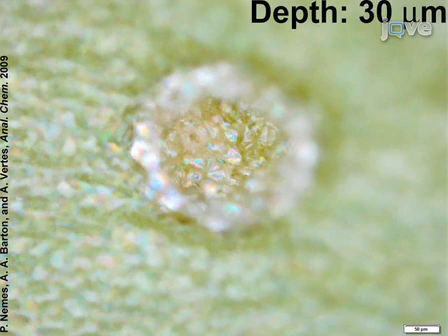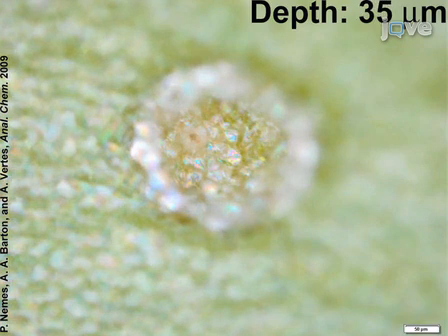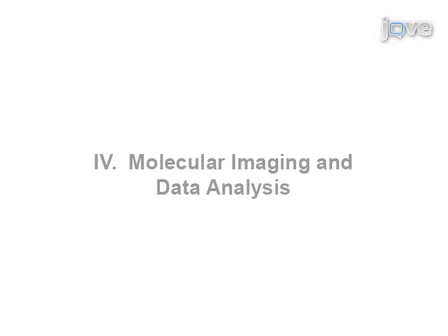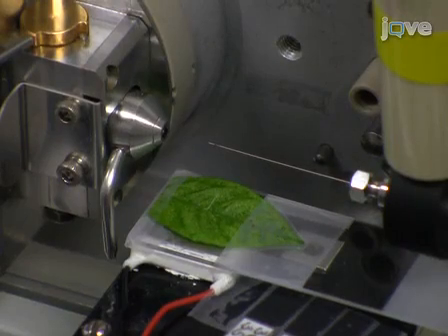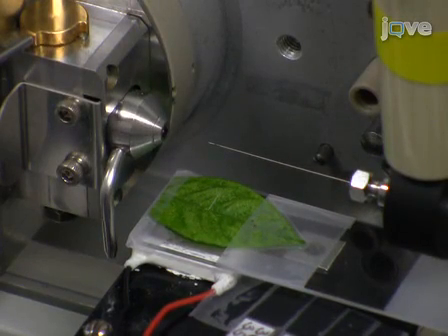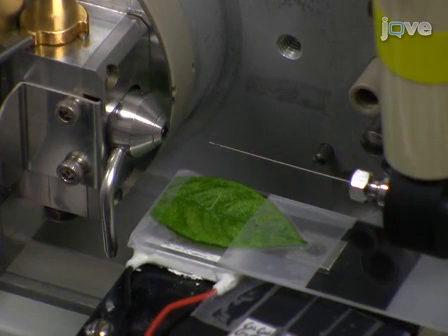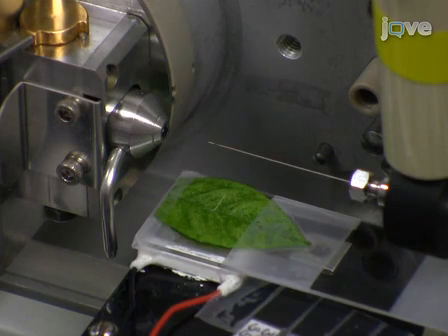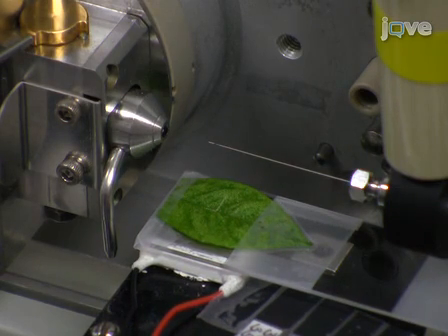Now that the tissue mounting conditions and the ionization source are optimized, proceed to molecular imaging. In the imaging experiment, the tissue sample is moved in the focal plane of the laser in the X and Y directions with step sizes larger than or equal to the dimensions of the ablation spot. The spatial resolution is limited by the focusing of the incident laser beam.